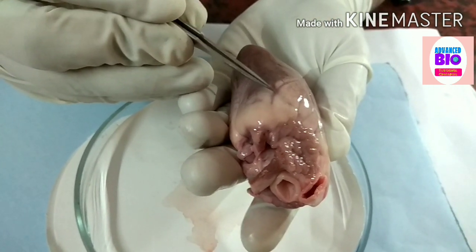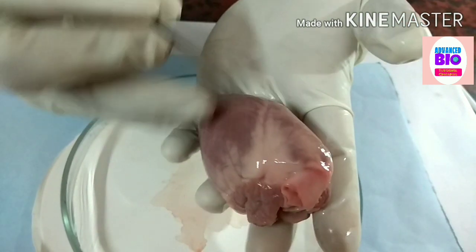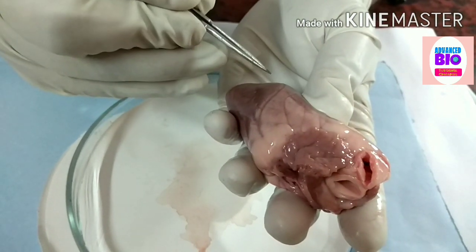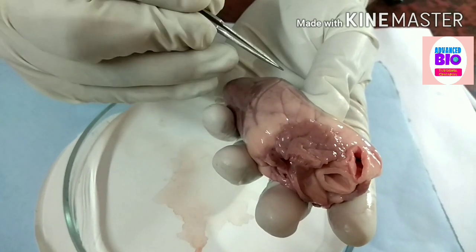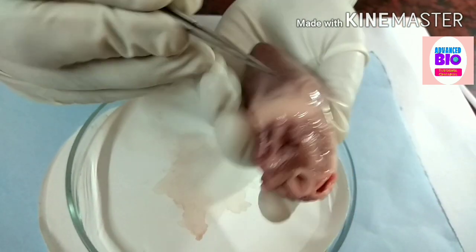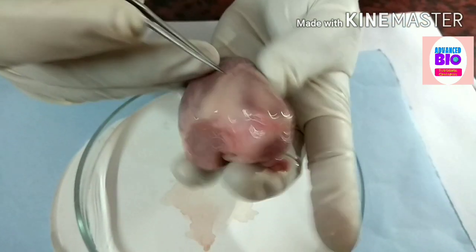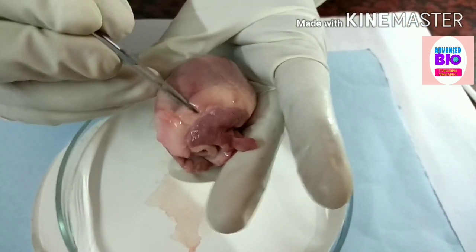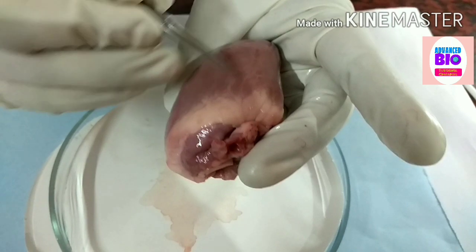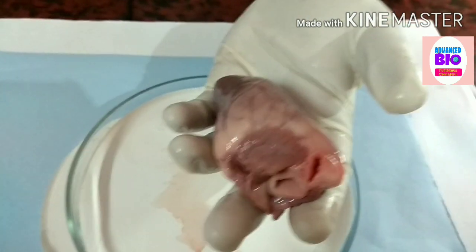If you see attentively, you can see on the surface of the heart these are all coronary arteries. This is the left coronary artery with its branches — the anterior interventricular artery and the circumflex. You cannot see the marginal branch here because of fat bodies. This is the posterior interventricular artery. There are also many coronary veins.